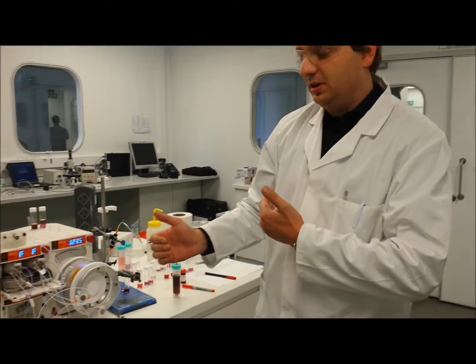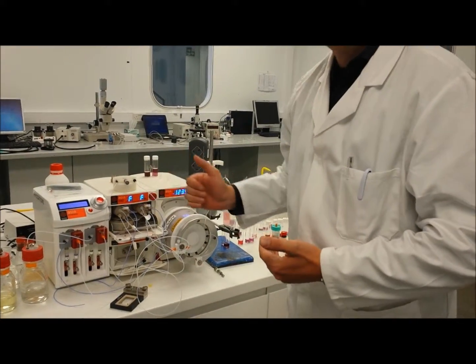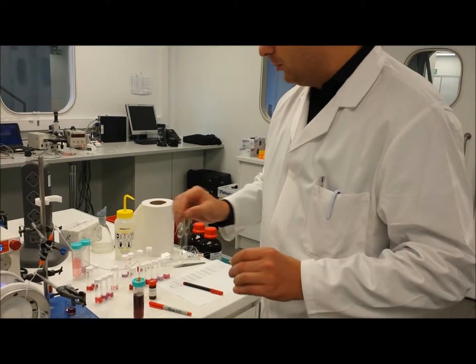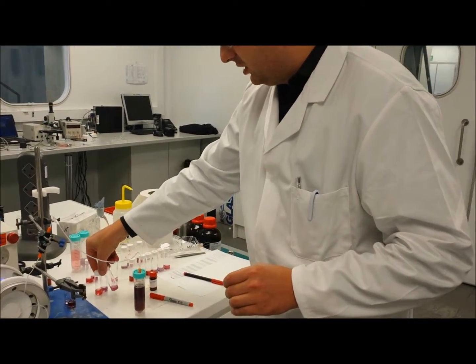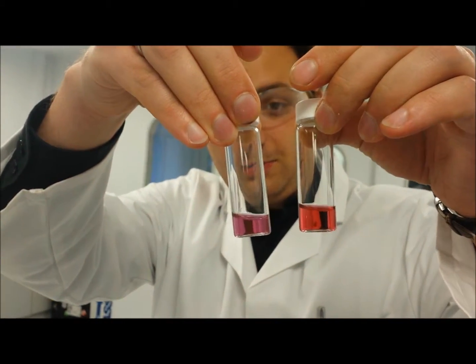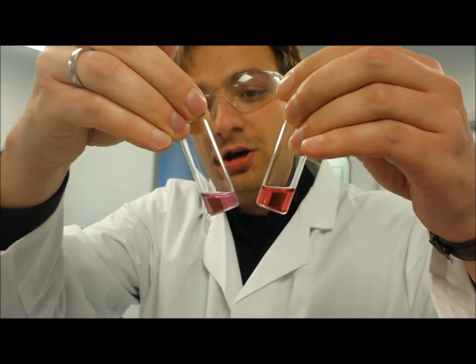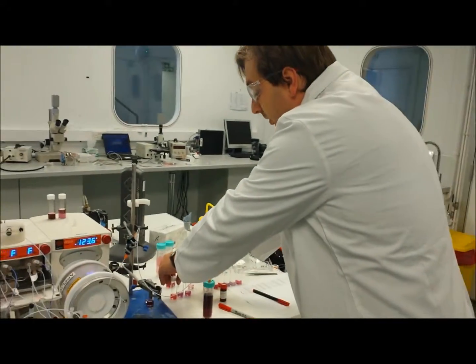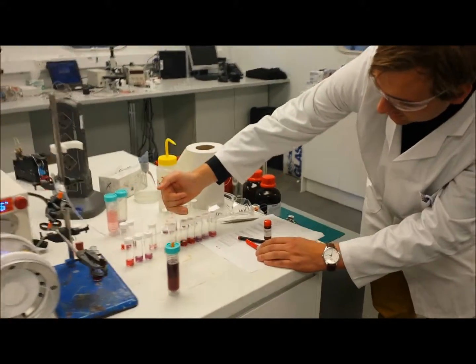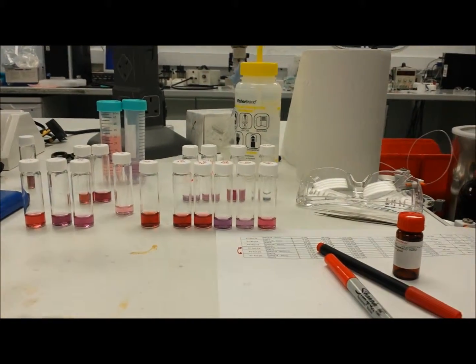That is not so in the flow chemistry setup, because, as we've already demonstrated, the mixing is fast, the conditions are well controlled at each step. So what we can do is, just by changing the molar ratio of the two reagents in very, very tiny quantities, we can control the particle size and consequently the particle color, or the color of the solution of these gold nanoparticles. We can also change the residence time, i.e. the time they spend in the reactor, and thus obtain this progression of colors here. This is 10 minutes, 15, 20, 30, 40, and finally 60.